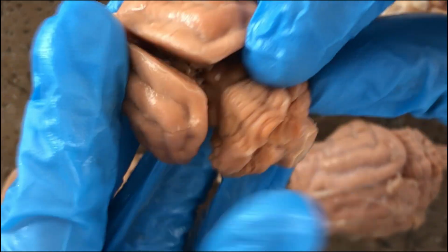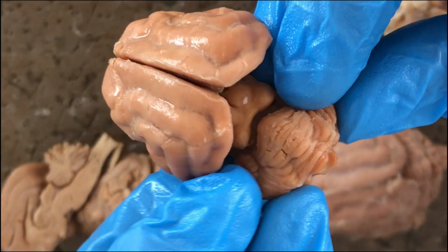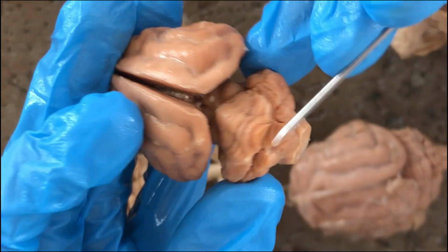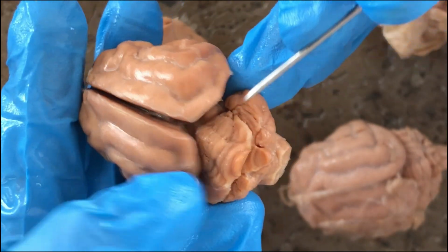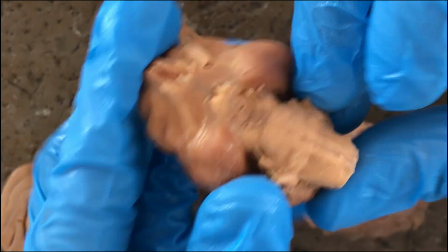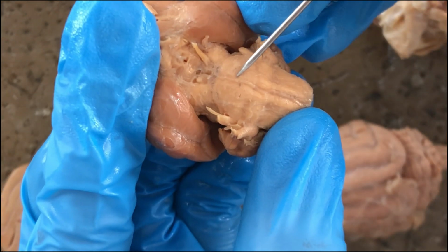And the two lateral bulges of the cerebellum would correspond to its hemispheres, the cerebellar hemispheres. So there's a worm or vermis of the cerebellum and then the cerebellar hemispheres. Alright, and this is the pons.